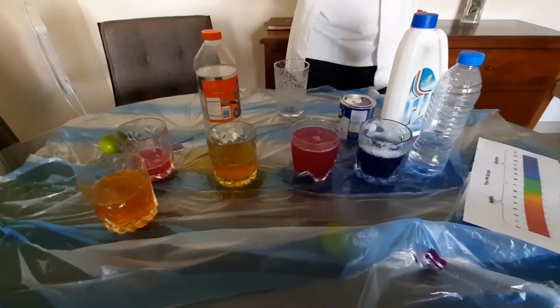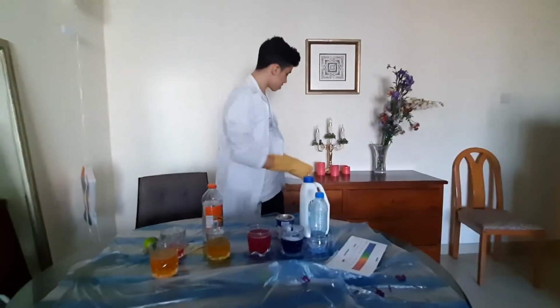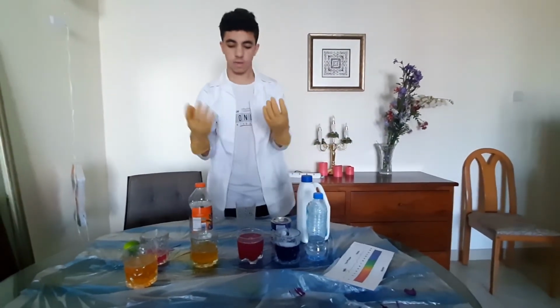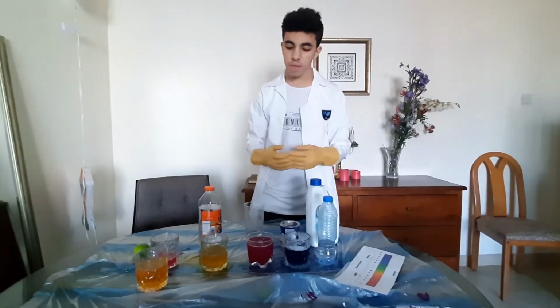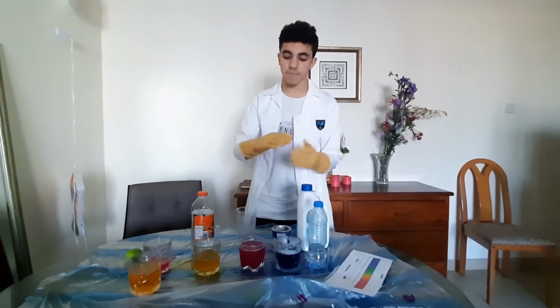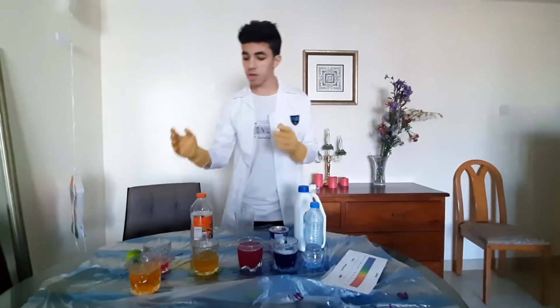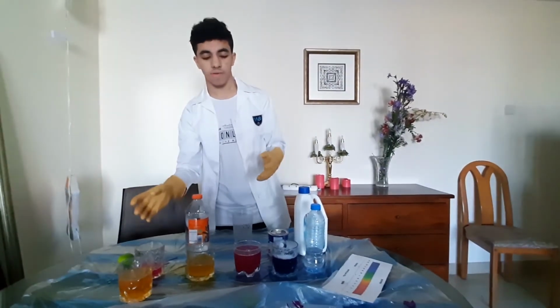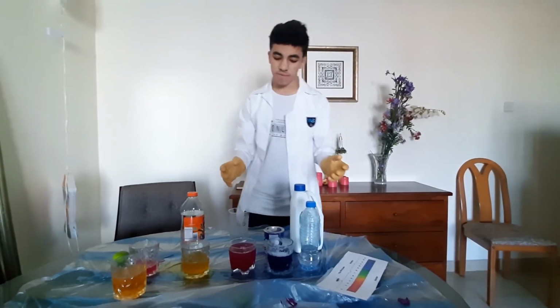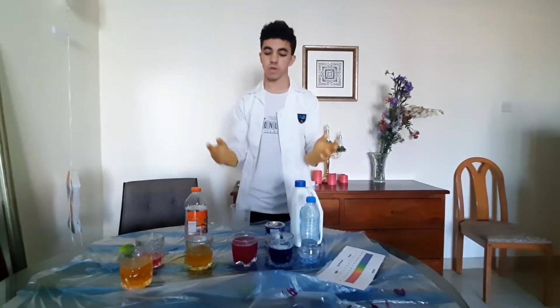An example of this damage can be skin burns. That's why we use equipment such as this and this, in order to prevent skin burns or skin cancer. Alkalines can also make your skin very rough and can peel off the skin. So we can observe that the acids are very corrosive, while the alkalines can cause severe damage to your skin. So I advise everyone to use these safety measures when doing such experiments.